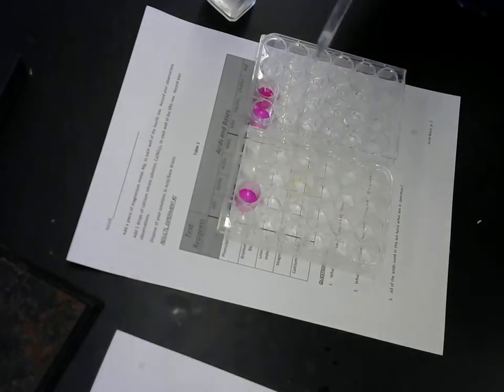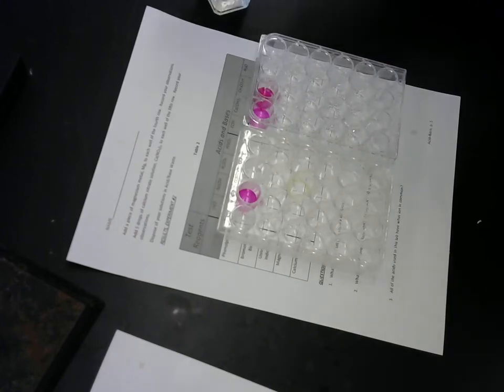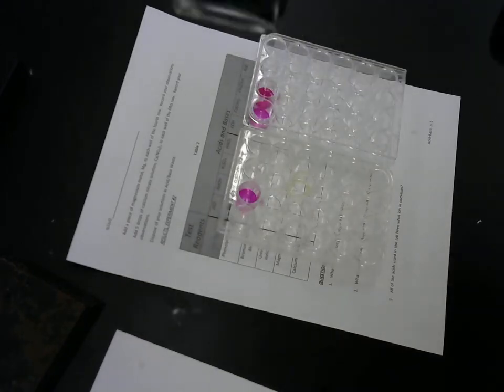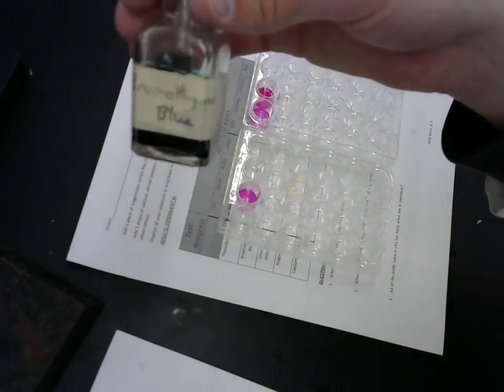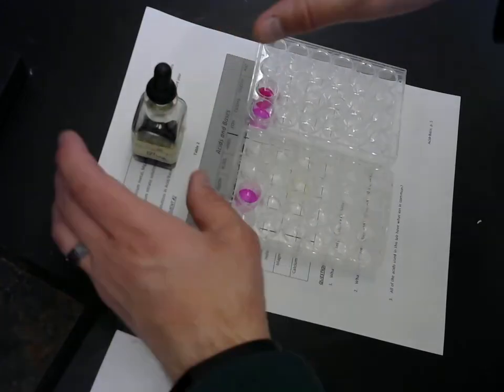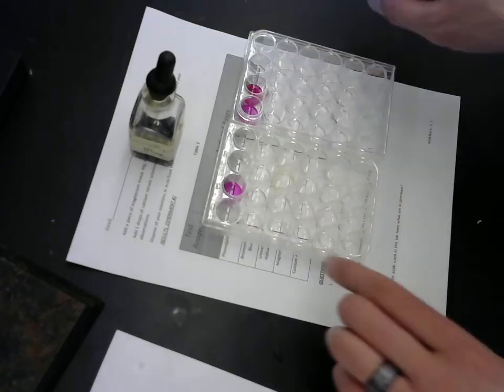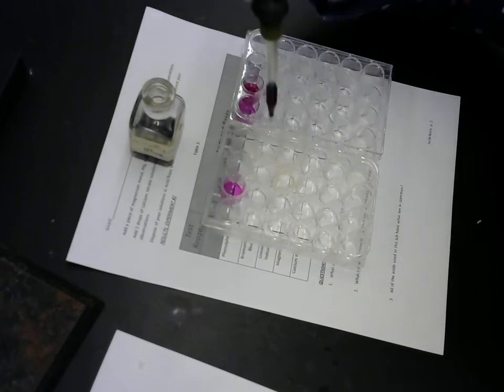Can you put the phenolphthalein back there? That's cool how it's a cap and a squeezer. Okay, the next is a color indicator called bromothymol blue. Wait, bromothymol? Bromothymol blue. And there are lots of different color indicators. Well, Lily, why don't you put a drop in each of the second row, and let's see what happens with the bromothymol blue.